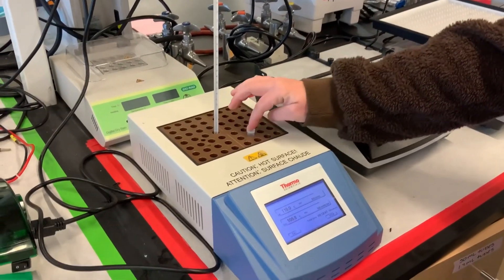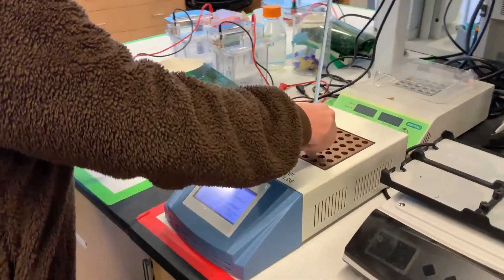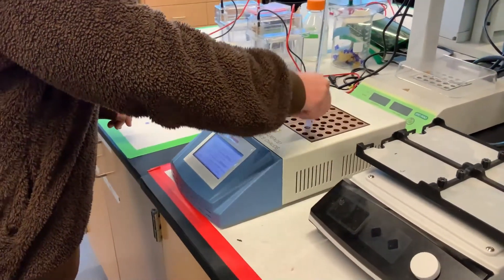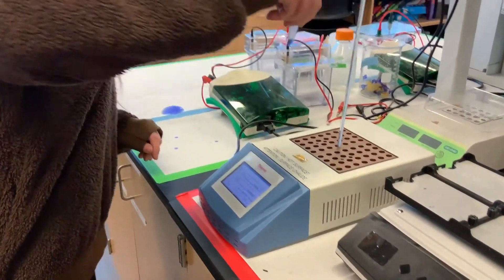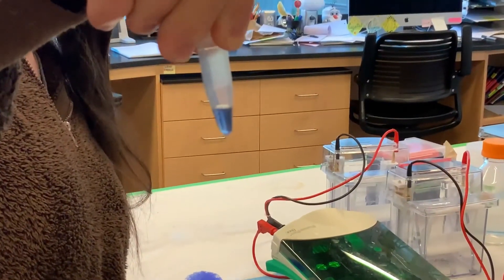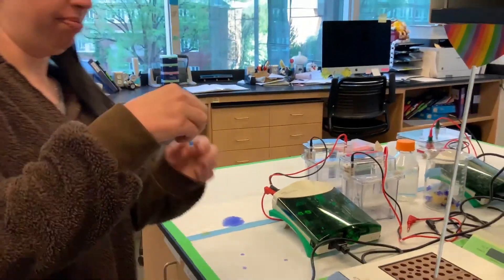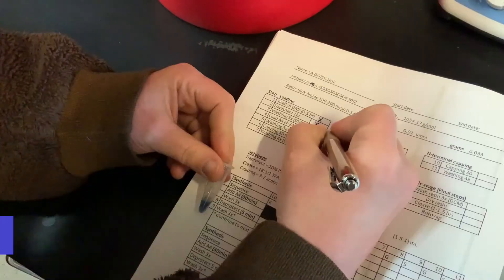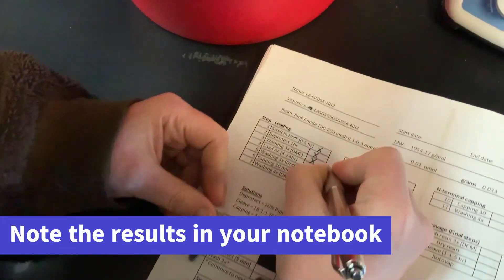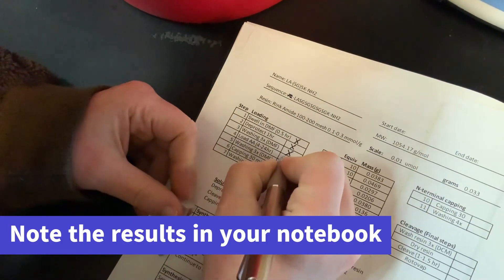Let the reaction heat at 110 degrees Celsius for 5 minutes. When the reaction is done, analyze the solution and bead color before moving on to the next step of synthesis. If you are satisfied with the results, remember to re-swell your resin in DMF for 5–10 minutes before continuing.